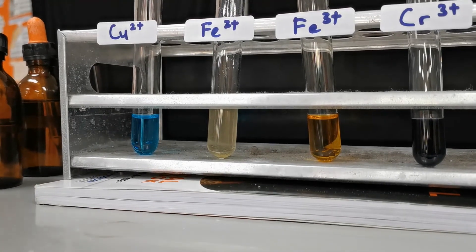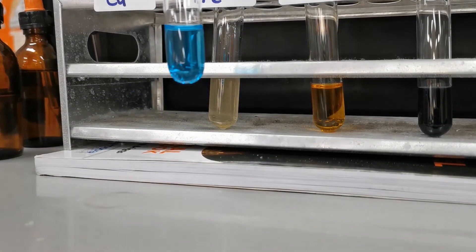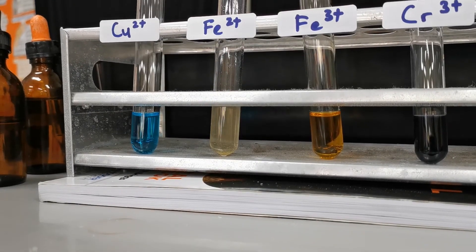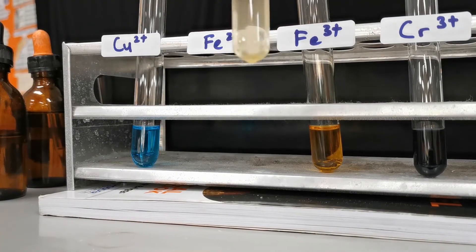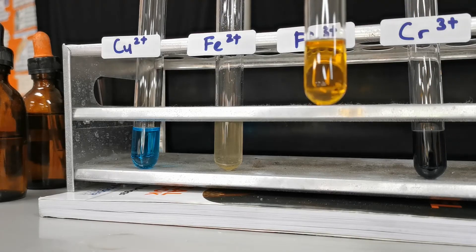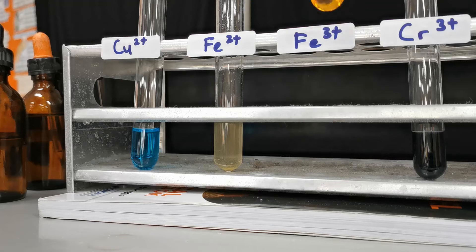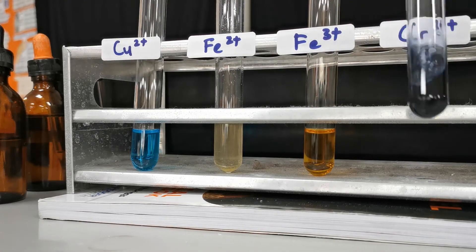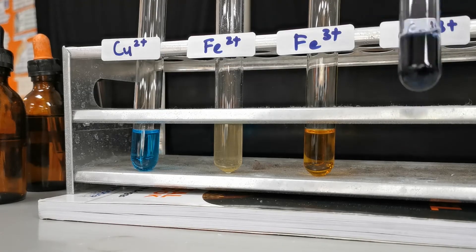Now with the same solutions, please take note of the original colors first. Copper(II) is blue, iron(II) is greenish-yellow, iron(III) is a sort of pale red-brown color, and chromium(III) is a deep blue-gray color.